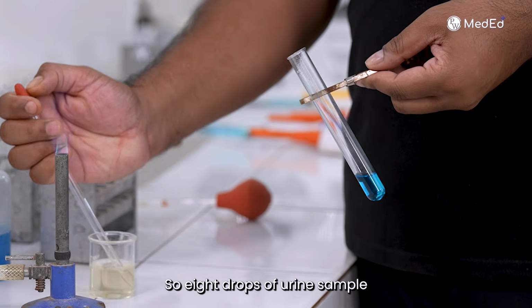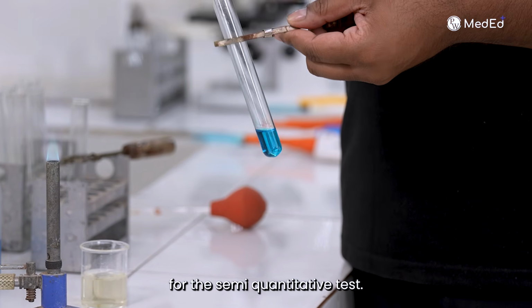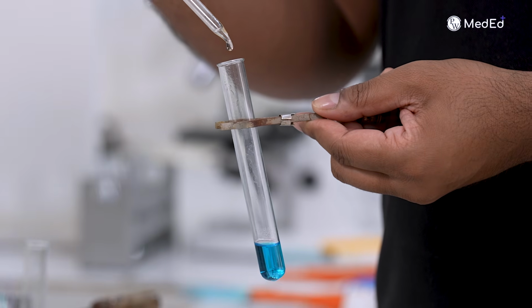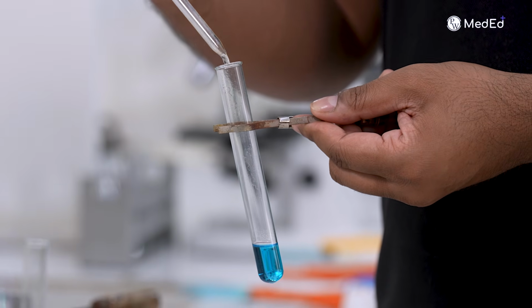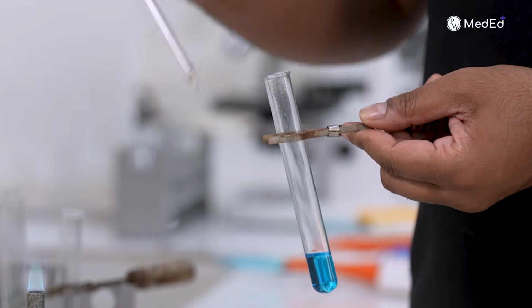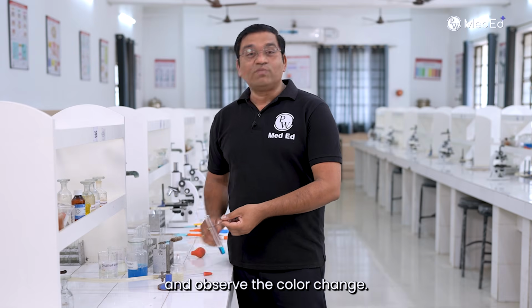So 8 drops of urine sample for the semi-quantitative test. Okay, and boil for 1 to 2 minutes and observe the color change.